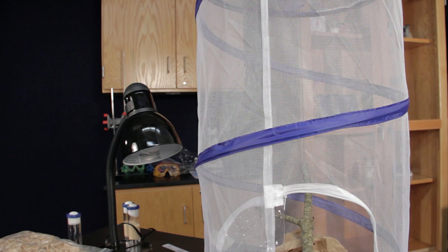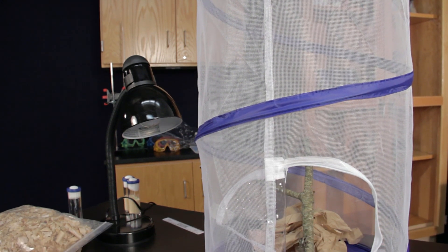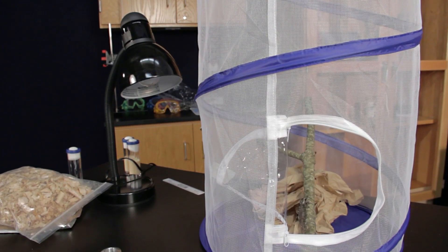Keep the container and pupa at room temperature while exposed to a normal day and night cycle. The moth should emerge in seven to fourteen days.